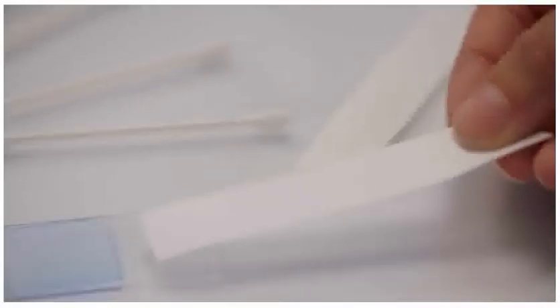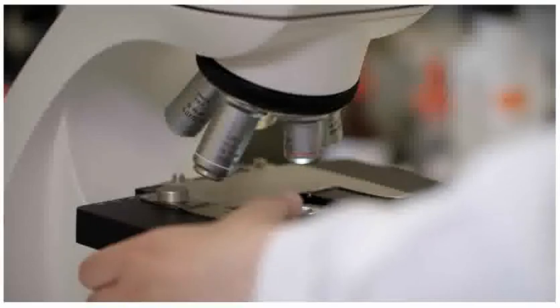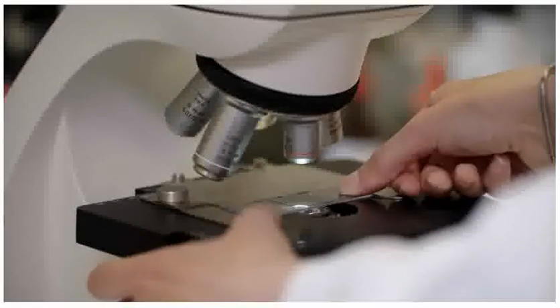Excess methylene blue is removed using filter paper. The slide is left for one minute to give time for the stain to work. Set up the microscope as before.